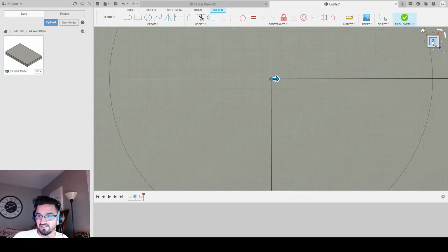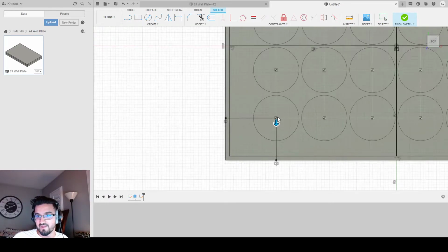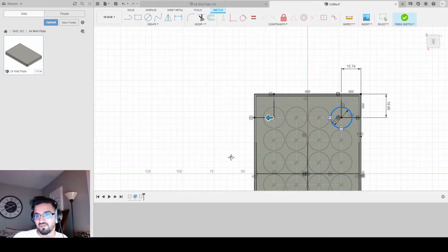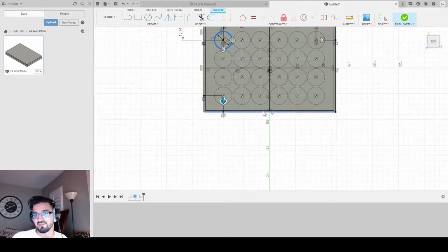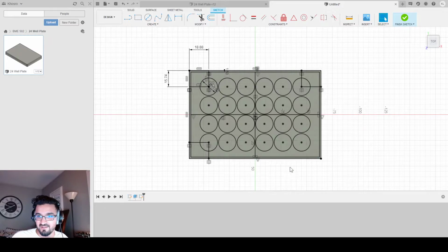Now that I have that, I can just click top, rotate, pull, zoom out, and I can see that I have a 24 well plate. Yay. Sorry, it rotated on me. Getting confused with my 3D software controls. And we're done with the rectangular pattern. Yay. Look at all my 24 wells.